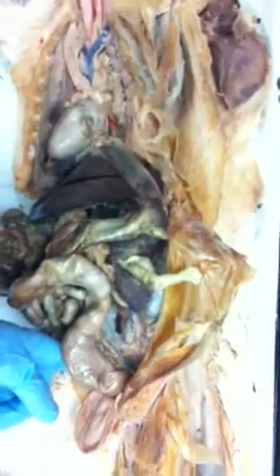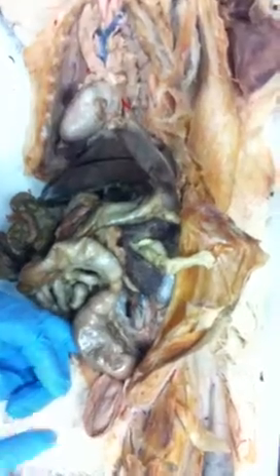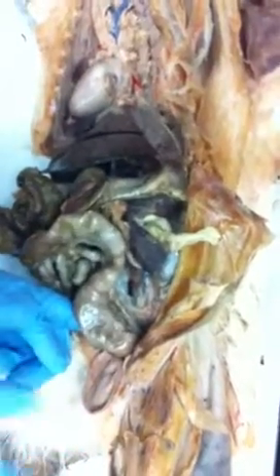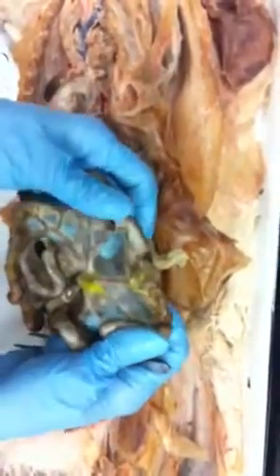It holds the colon in the same place. Is that the same thing that's between all the... No, no. That's a mesentery too, but this particular mesentery, its function is to hold that colon in place, that rectum in place, so that we can compact the waste. Okay? This up here, what you're talking about here, this is the mesentery. Yeah. That's the mesentery right there.